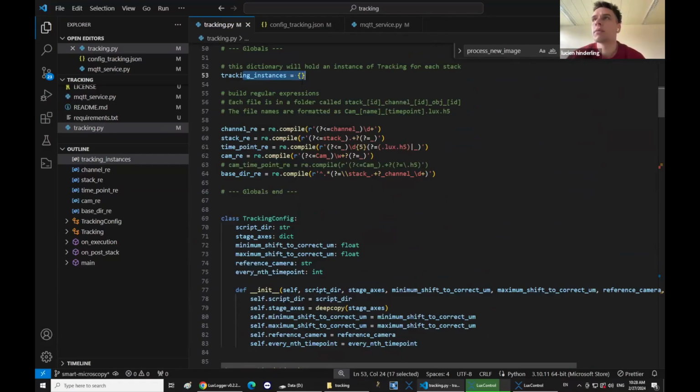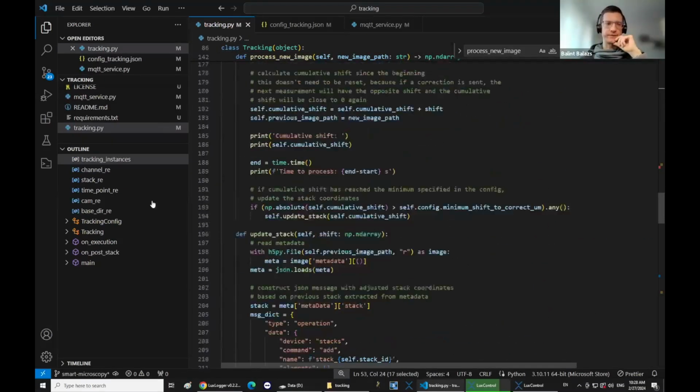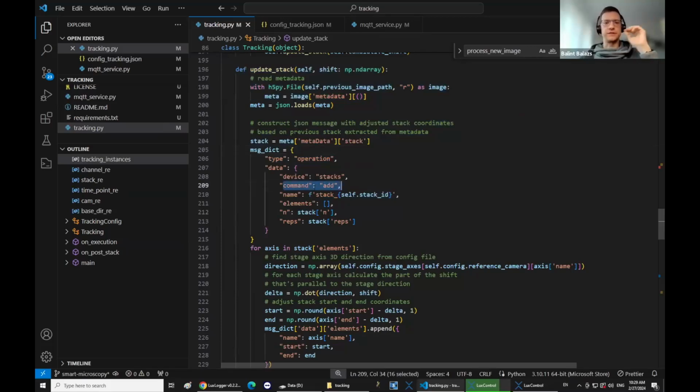So when you sent the JSON message after tracking, you said you add a new stack. No, so basically what this update stack, right? This one. Yeah, so the command is add stack, but if you also provide the name, it will update the existing one. Yeah, sorry. Okay, got it. It's a bit confusing. If you don't give it a name, then the microscope will just create a new stack for you. But if you provide the name, then it knows, okay, this was already there, and it just replaces the old one with the new coordinates.